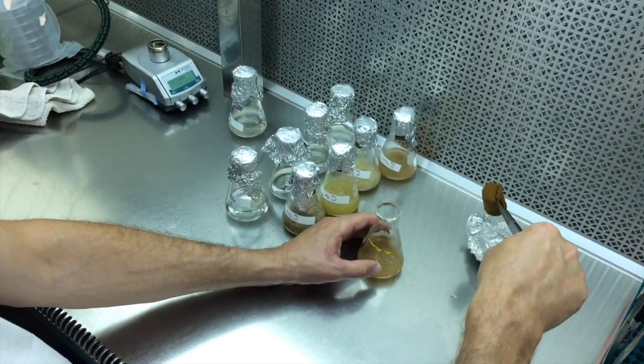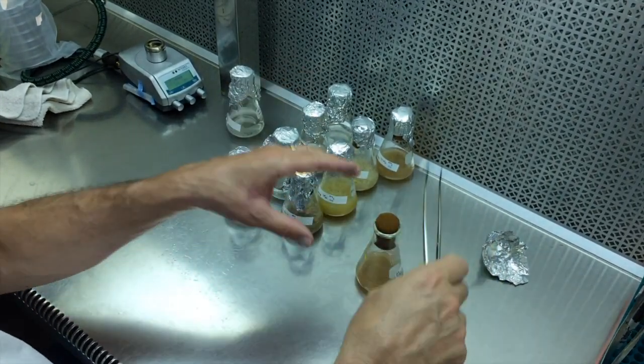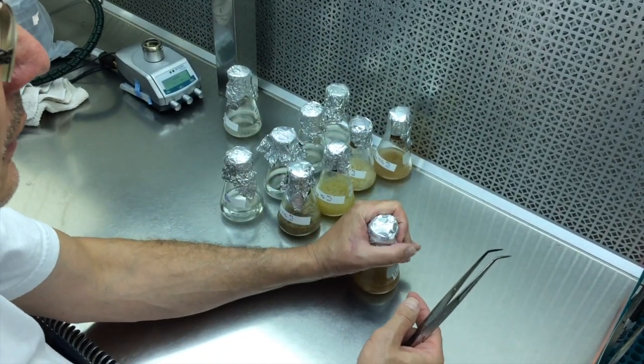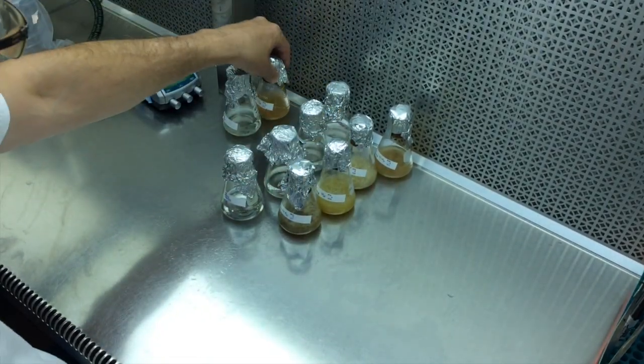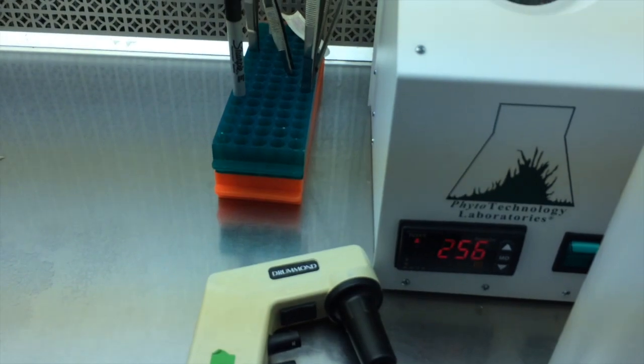And grab it on the edge, put it in there, turn as you go, it goes right down inside. You're not trying to push it the whole way down inside, nor are you trying to smoosh it from the top. You're just trying to snug it up there nicely. And there you go. At this point, I usually throw that one back into there. Three seconds is usually enough after it's hit 200. That's degrees Celsius, by the way, not F. So it's freaking hot.